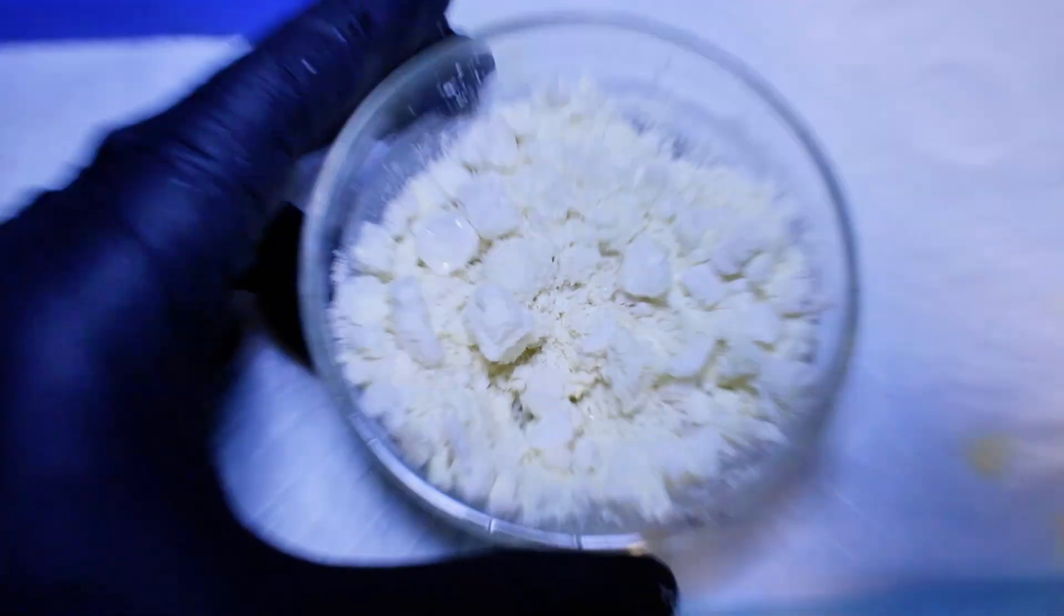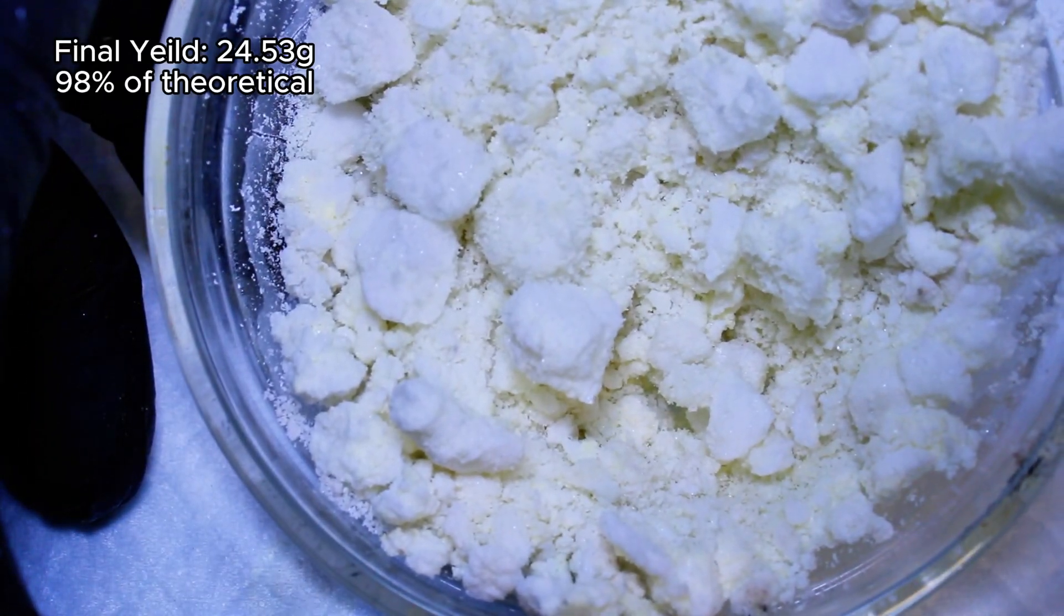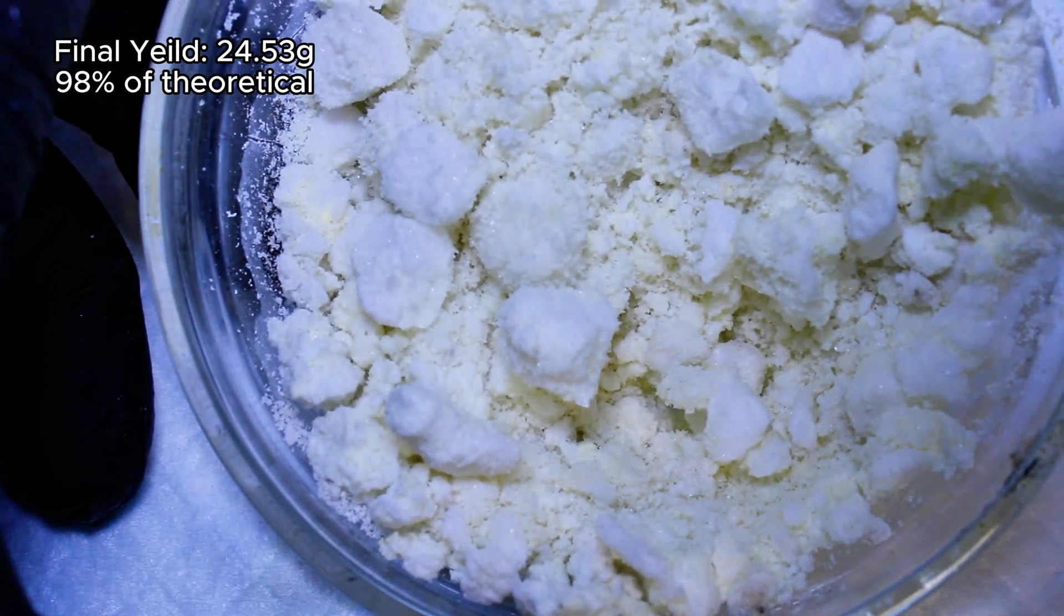Once the product was now completely dry, I weighed it and got a final mass of 24.53 grams, which represents a 98% yield.